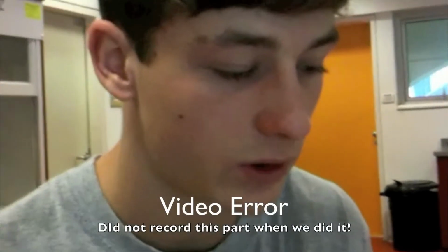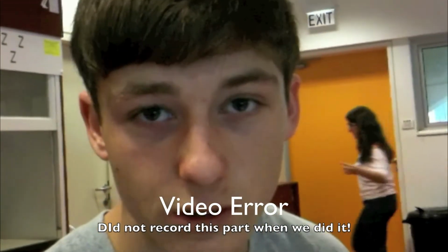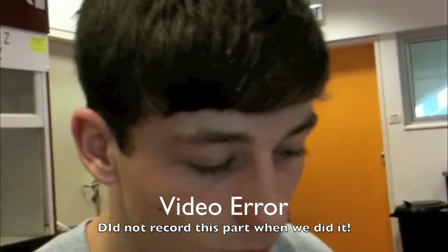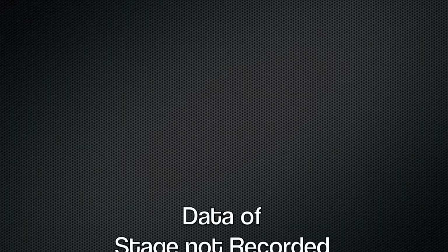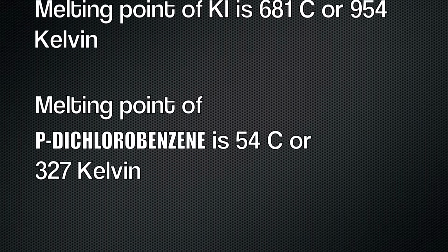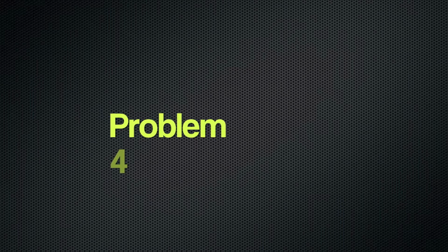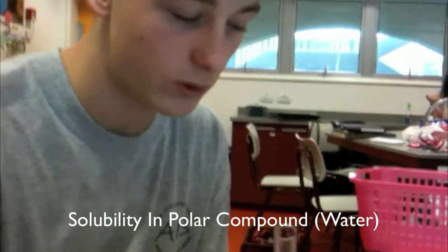Now we skipped the third one because we couldn't find the hot plates. So now we're doing part 4.